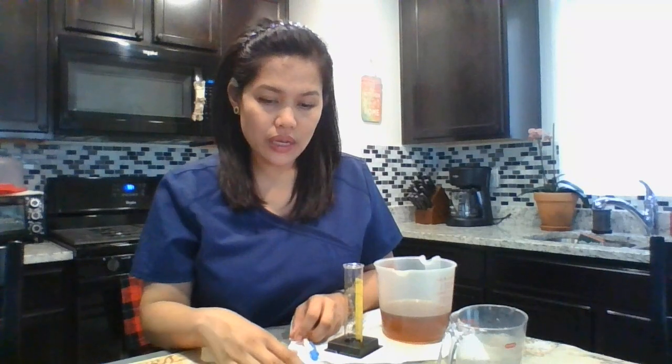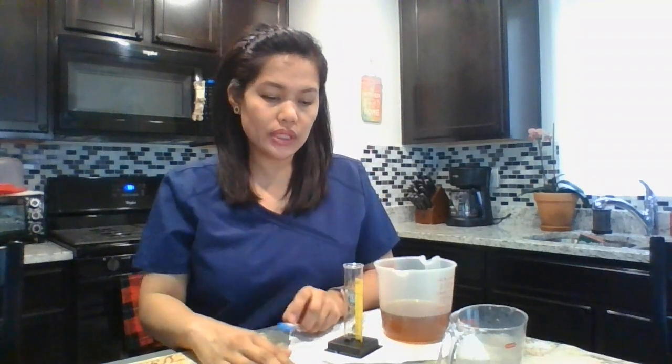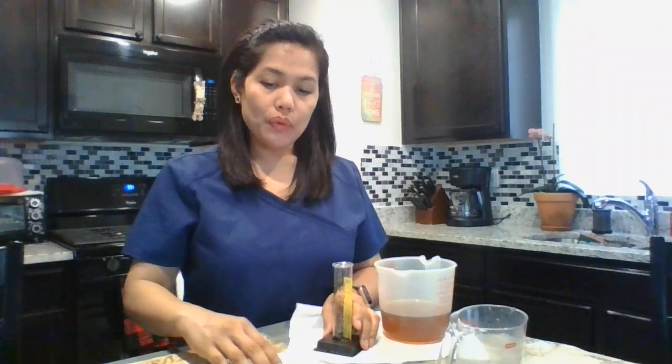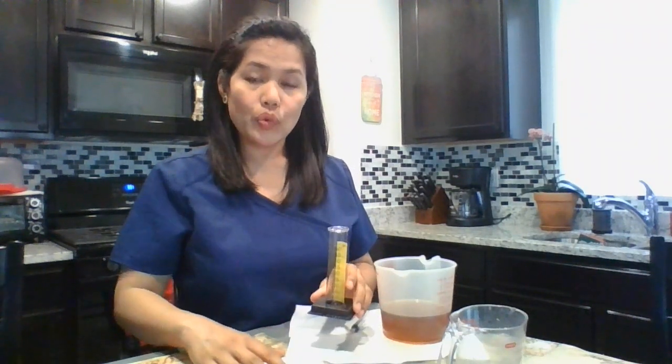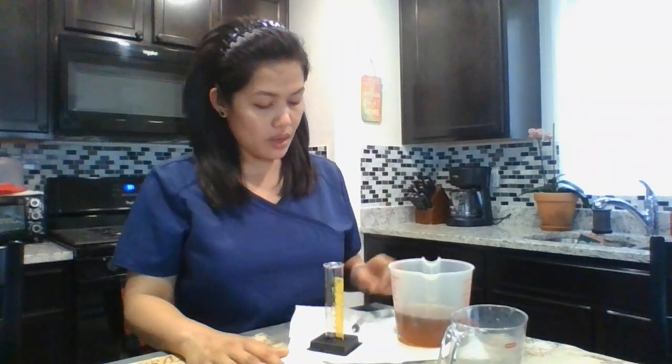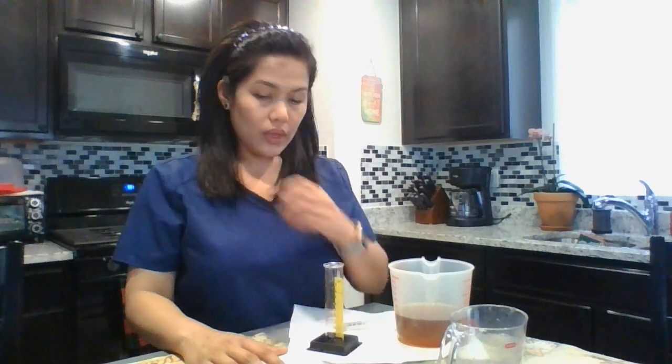In this video I'm going to do skill number 4, which is about counting and measuring liquids. I will need a 50 ml graduated cylinder, colored water, and a 5 ml oral syringe. To use the 20% rule, I need to know what is the 100% of the milliliter amount given.